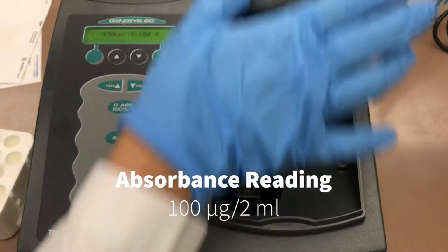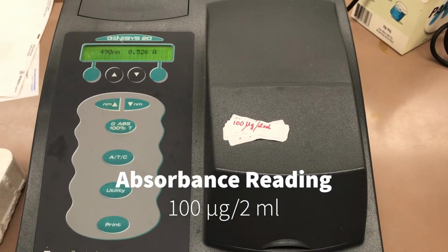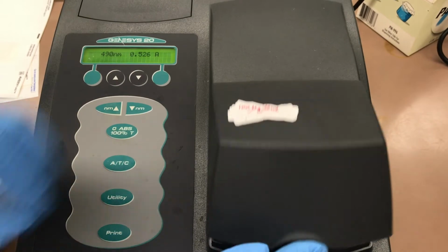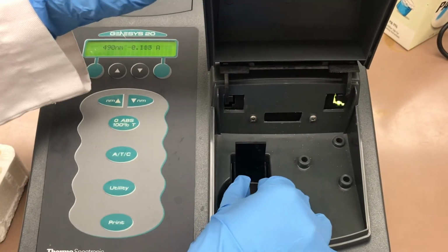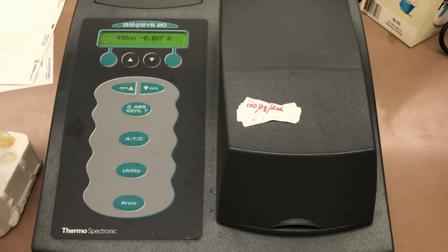This is the absorbance reading for 100 micrograms of glucose per 2 milliliters. Next, we will find the absorbance for the Sprite and beer samples, starting from the regular Sprite.